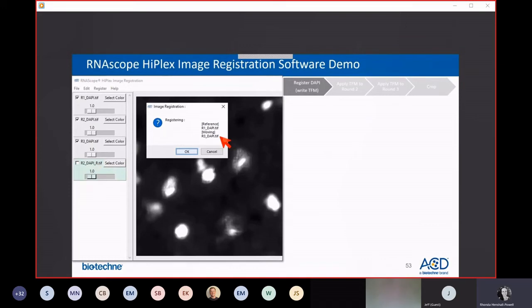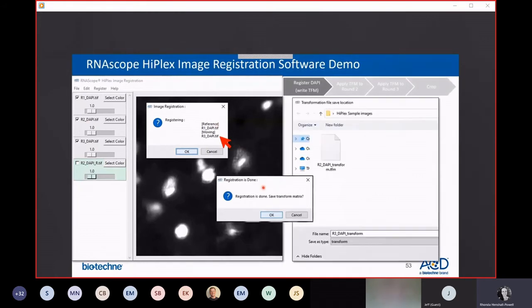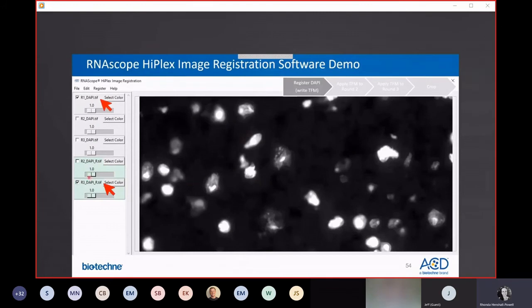Now, what you'll do is create a transformation matrix that moves your round 3's DAPI onto round 1's DAPI. Again, you see in the dialog box, it will tell you which is the reference image and which one is being moved. And again, it will ask you to save the transformation matrix file that the software will write. Once the image is registered, again, it appears here in green with underscore R. And you can check the alignment by toggling on and off the R1 DAPI image that served as your reference and the registered images from R2 and R3, and they should overlap perfectly.